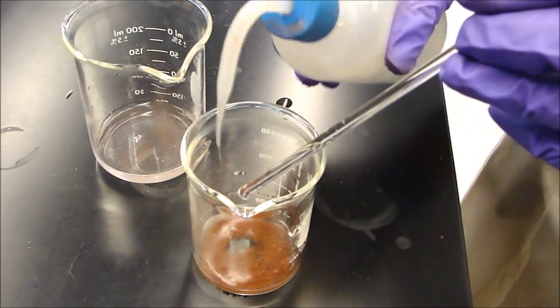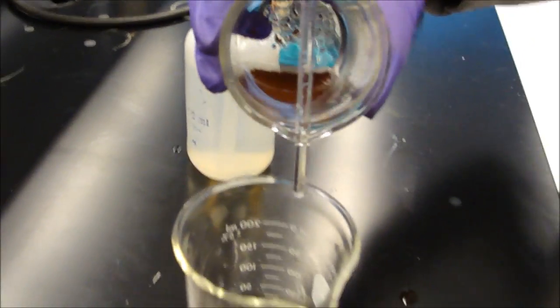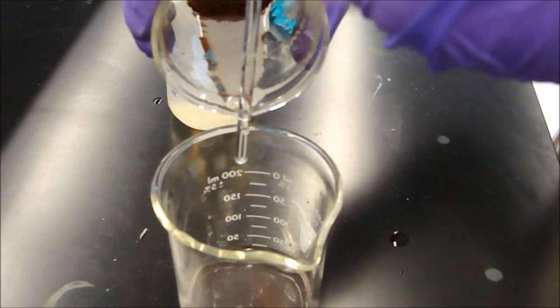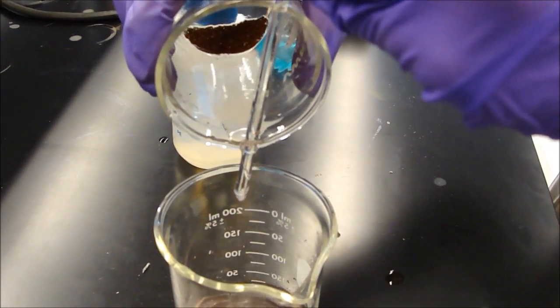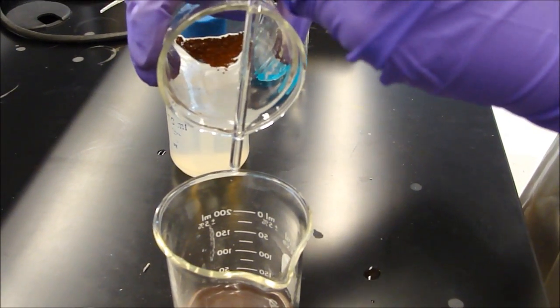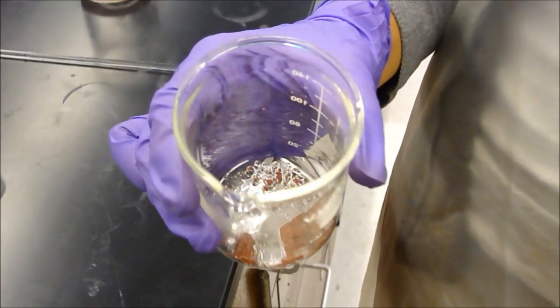Use a wash bottle to squirt some water into the beaker to rinse any solution from the copper. After you do this, you can remove the water by decanting again. However, on the last decant, make sure to decant effectively by removing as much water as possible before taking it to the oven to shorten the drying time. The solid copper precipitate, which is left in the beaker, has an orangish color.